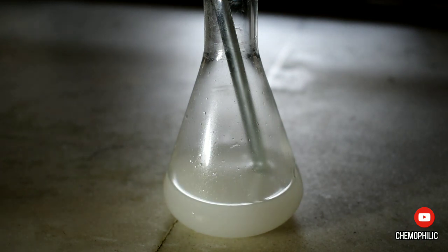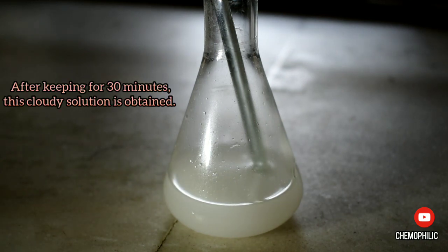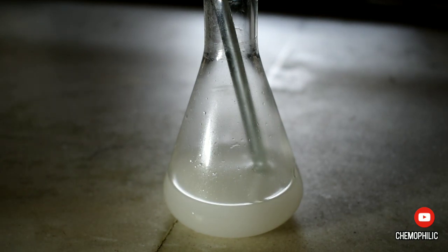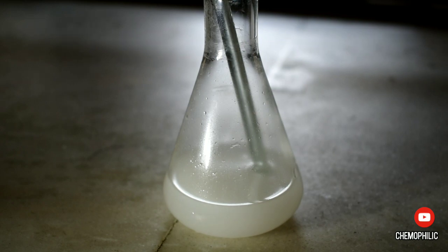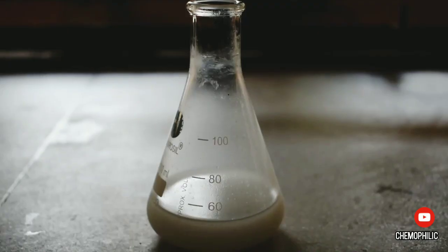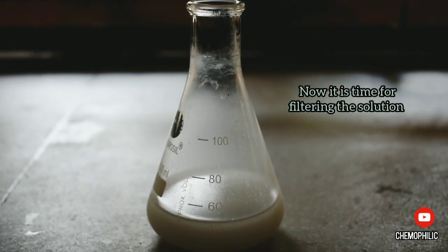I got a cloudy solution which was mainly due to the excess unreacted sodium hydroxide being insoluble in the organic medium. Hence, the solution needs to be filtered to get rid of the excess NaOH.